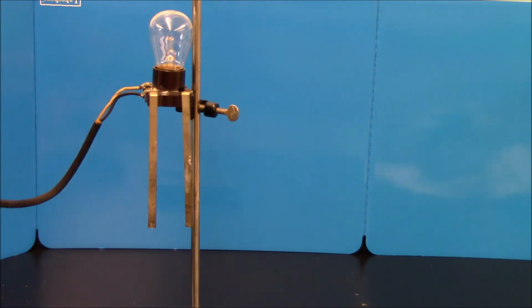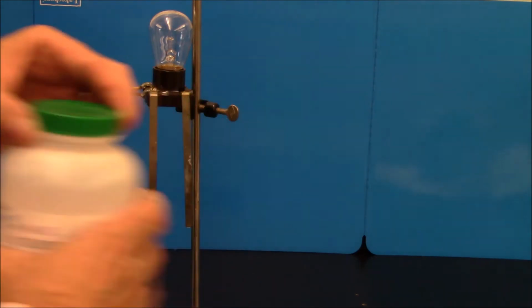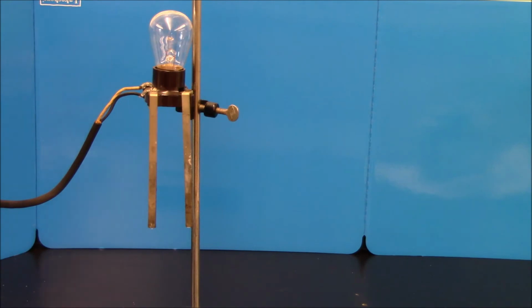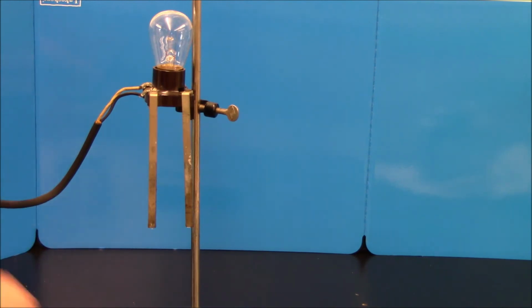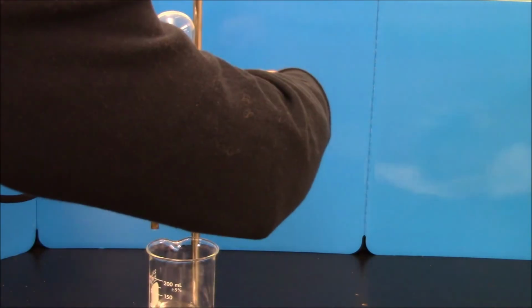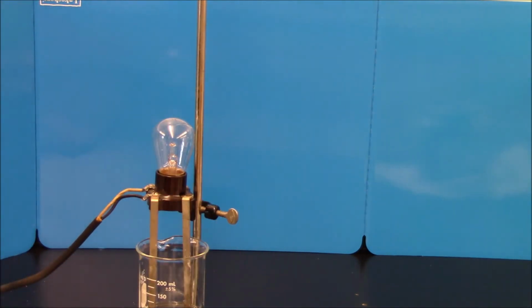Okay. Next up, I've got some glucose. Good old C6H12O6 from Bio. I'm just going to pour a little bit in, dissolve it in water. Dissolving in water is not enough to make something an electrolyte. Okay? An electrolyte has to produce ions, so even though the glucose dissolves in water, there are no ions. It's a molecular compound, and it's a non-electrolyte.